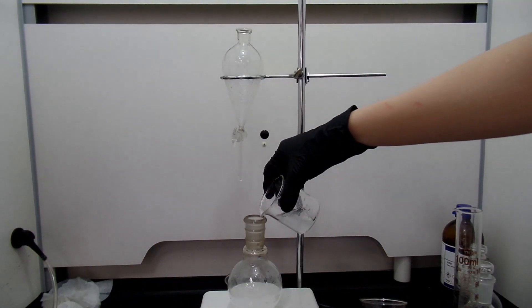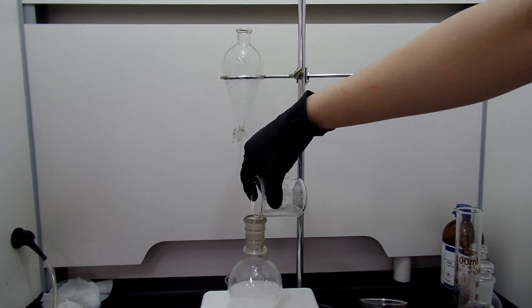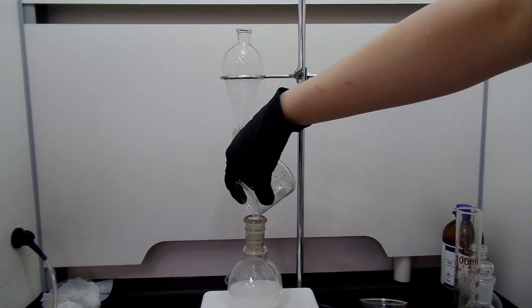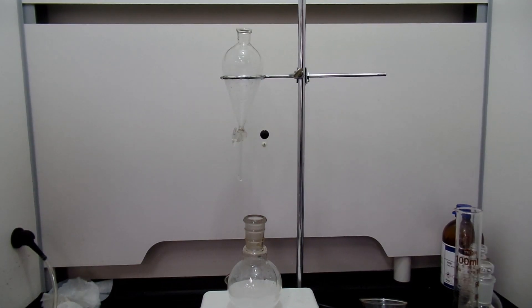Then I prepared 20 grams of sodium hydroxide dissolved in 20 mL of water. It heats up quite a bit, so be aware. I mixed the sodium hydroxide solution with benzaldehyde.